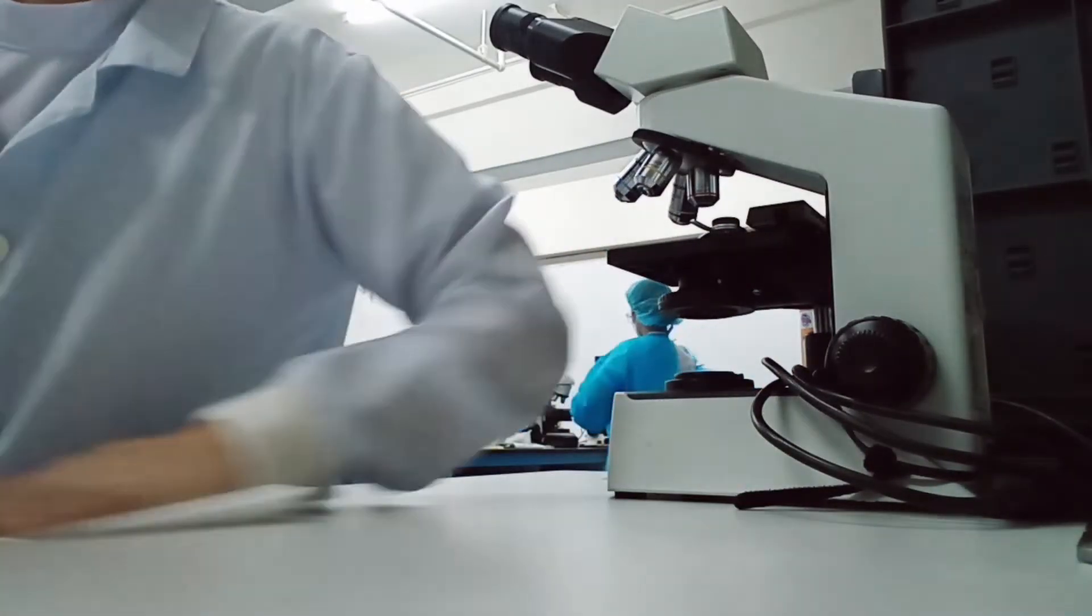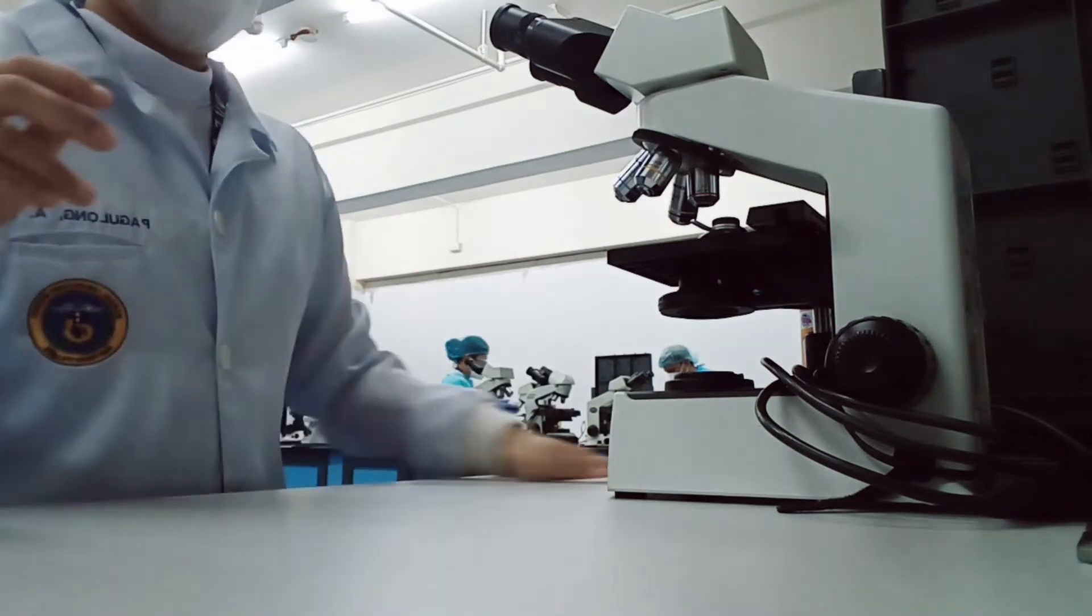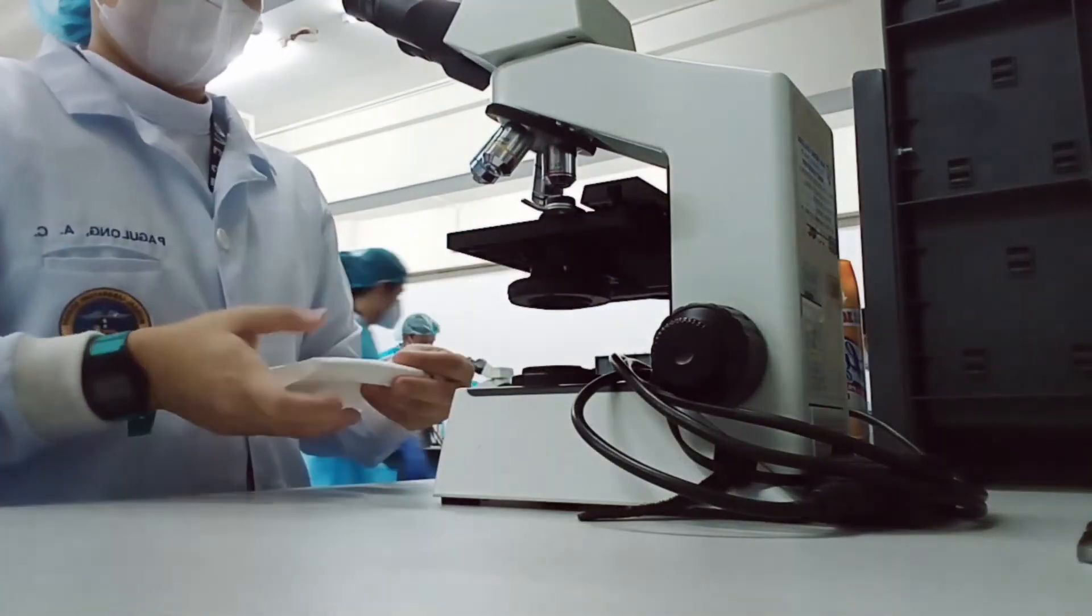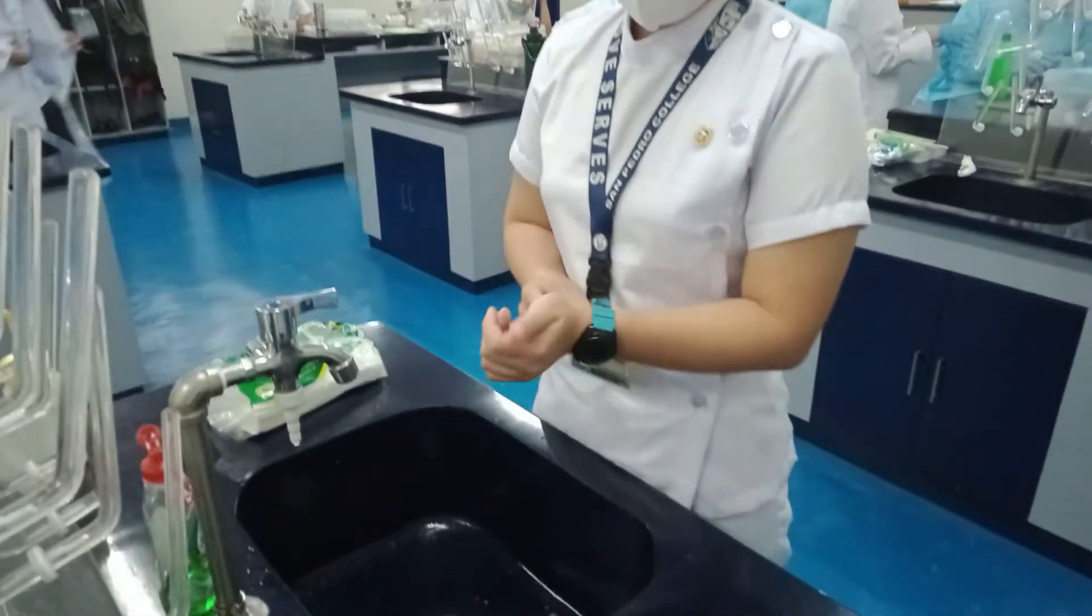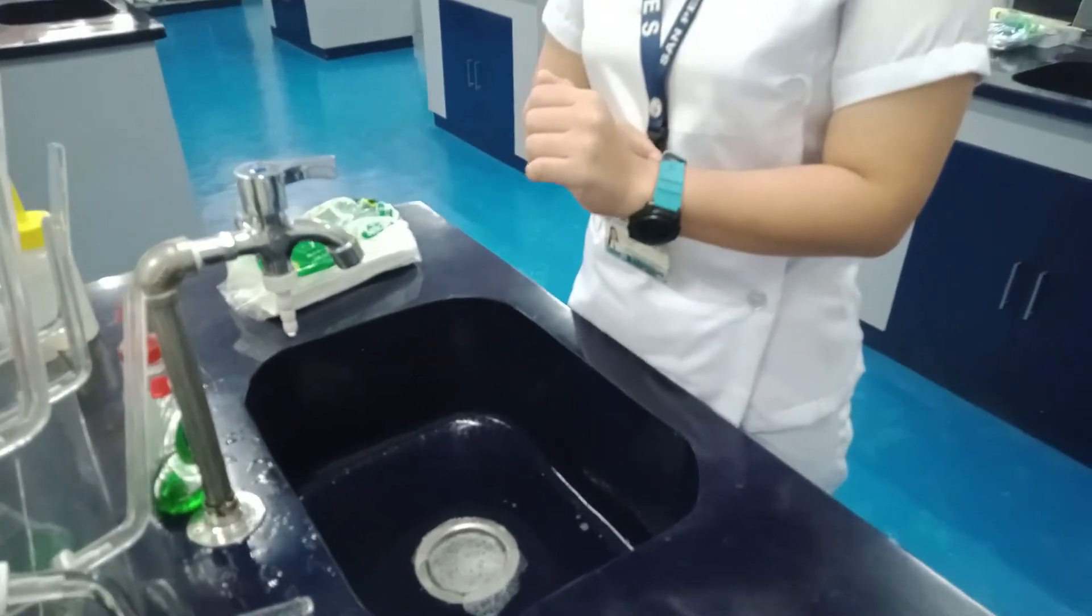After the test, clean the area before leaving. Perform the proper hand washing.